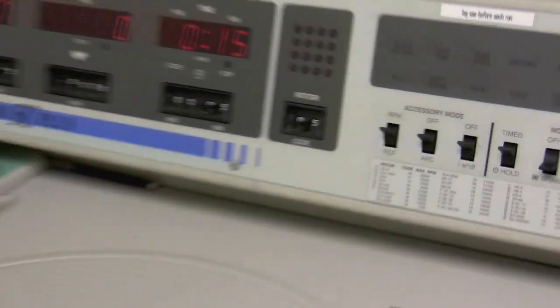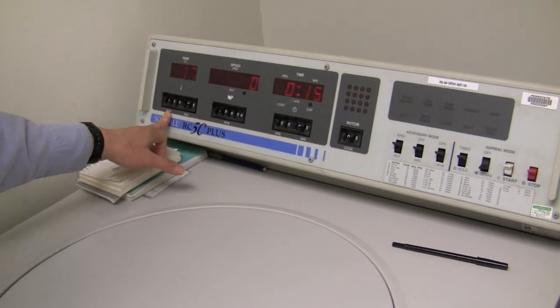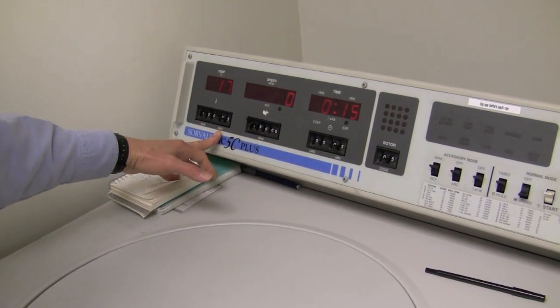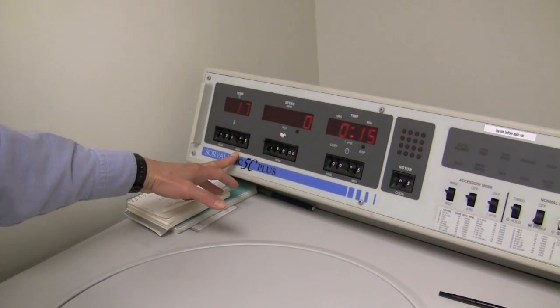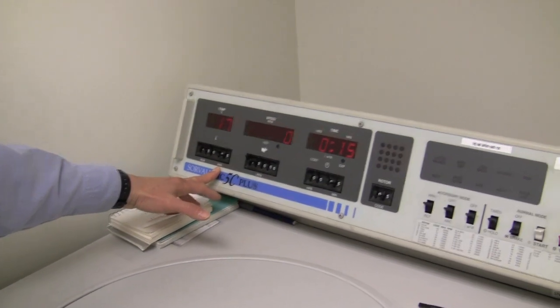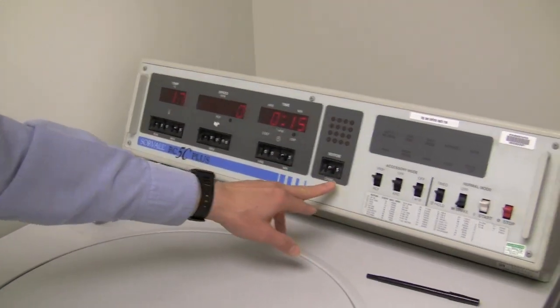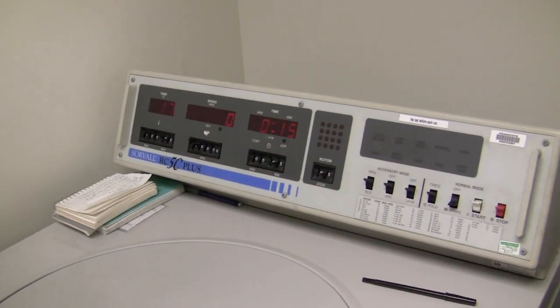Okay, so the run temperature of 20 degrees, 25 max means that if the temperature for any reason goes above 25 degrees, it's going to shut down the centrifuge. So it's a safety precaution. So we want to run it at about 20 degrees, 13,000 RPM, five minutes in the SS-34 rotor.